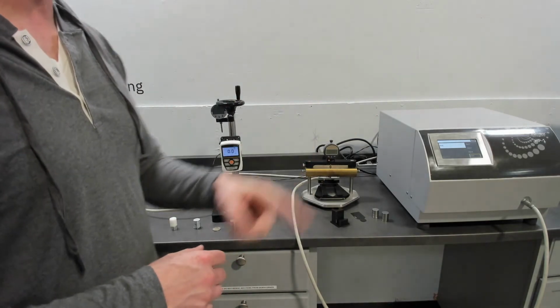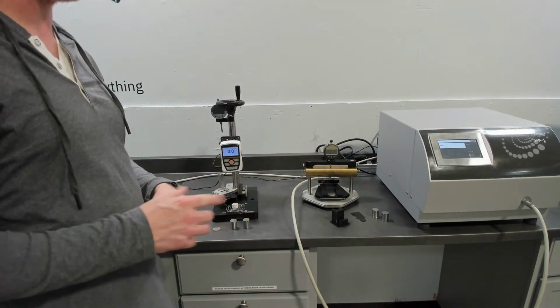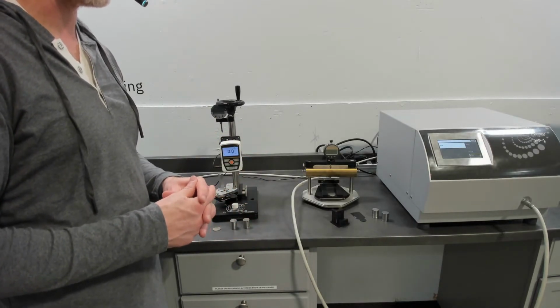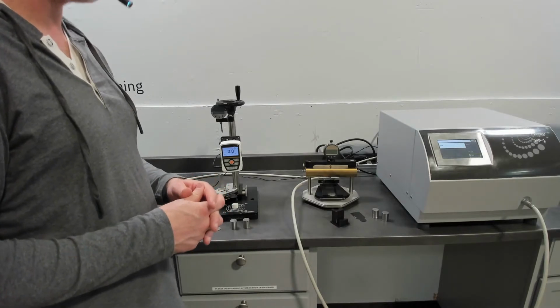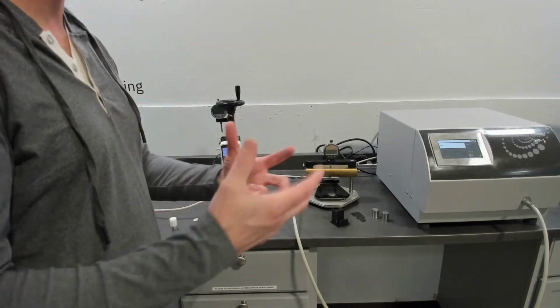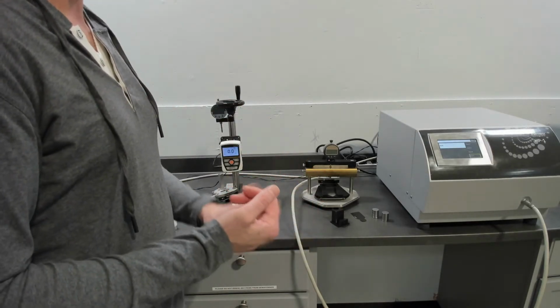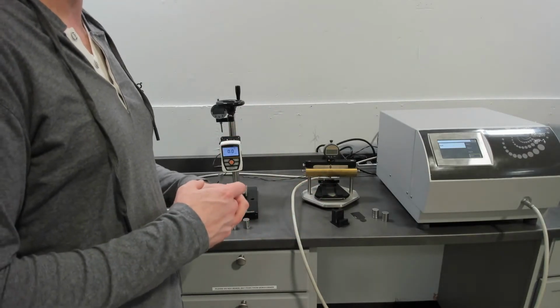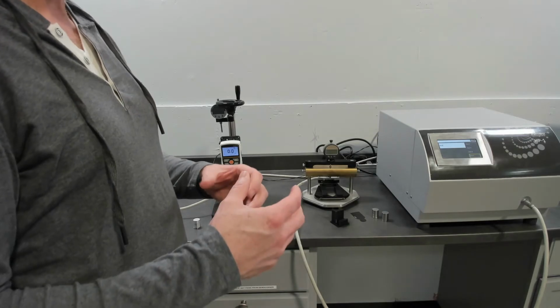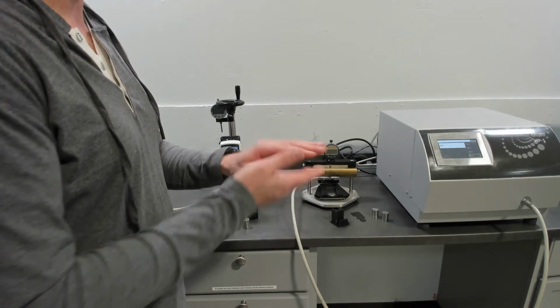Or if you look at ASTM E1530, which I mentioned before, or the sister method for measuring thermal interface materials, ASTM D5470, those do a pretty good method. They take a sound approach to the measurement, but are slow. They can be sensitive to improper setup, and a little bit complicated depending on how thin your material is and how many layers you need.